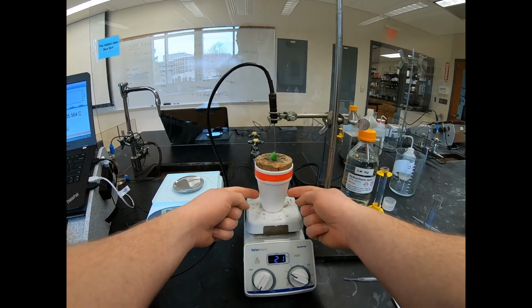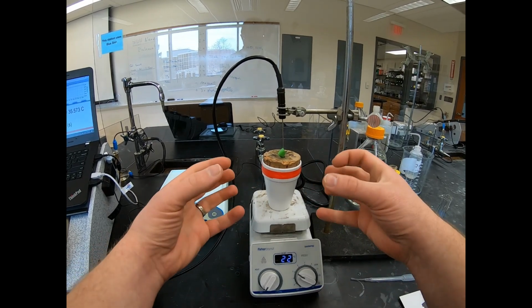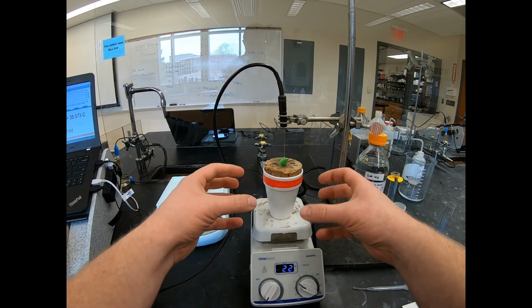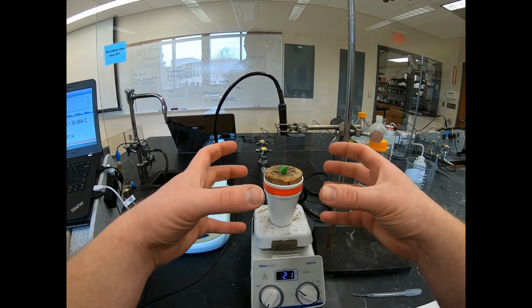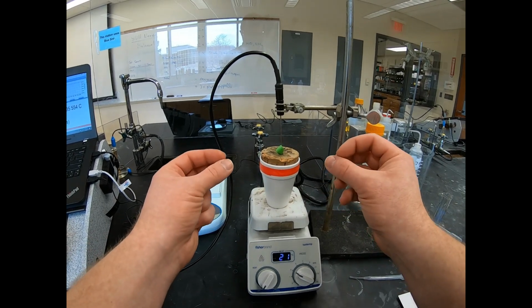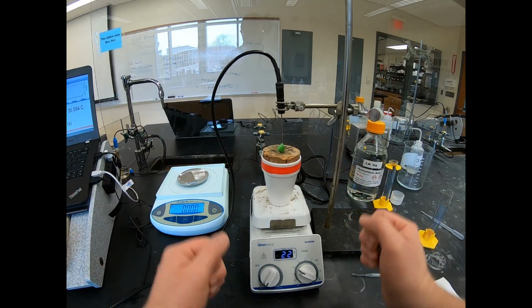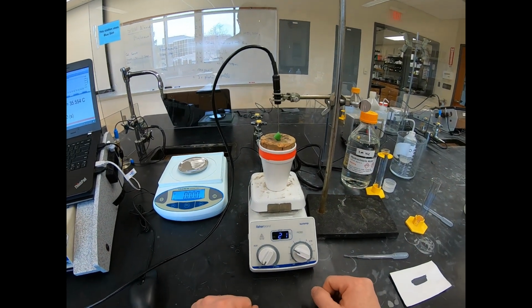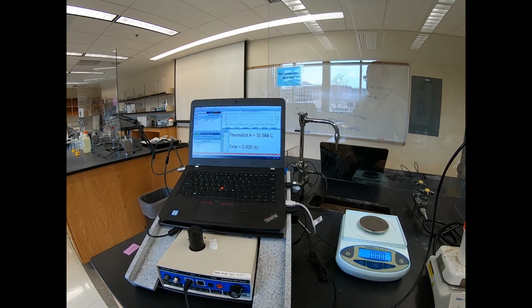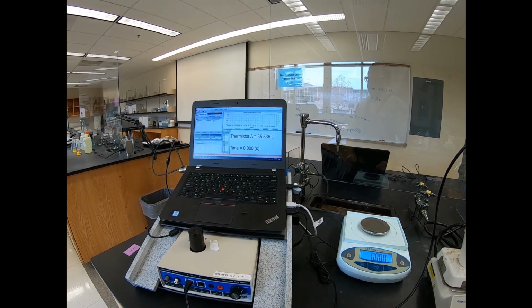Okay, so inside this calorimeter, we have energy being released overall from new bonds being formed, and that energy causes the water to heat up. After a chunk of time, this calorimeter holds the heat in fairly well, but over a period of time, that energy will eventually start to leak out of the calorimeter and into the atmosphere around it. That's why the temperature eventually starts to fall back down, and we can see that we've clearly fallen off where the peak was. So that will be the conclusion of this video.